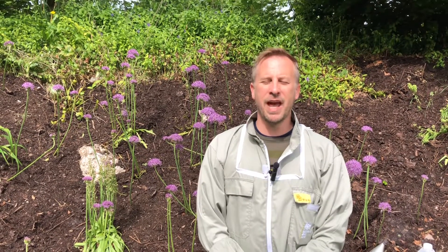Today I'm going to demonstrate an effective method for checking for varroa mites. In the UK, varroa mites kill more honeybee colonies than any other pest or disease combined. Checking for varroa mites is probably one of the most important things a beekeeper can do. If you don't check, you can't treat accordingly, and you also can't tell how effective your treatments have been.